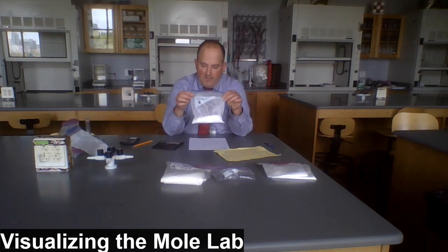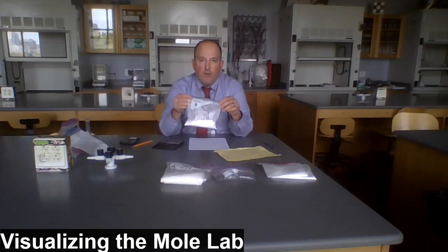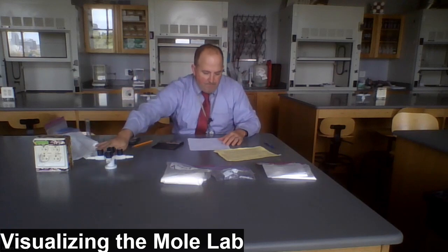The other one, calcium hydroxide, we measured its mass to be 75.5 grams, and its calculated molar mass is 74.1. Again, very close. So sample B is calcium hydroxide.